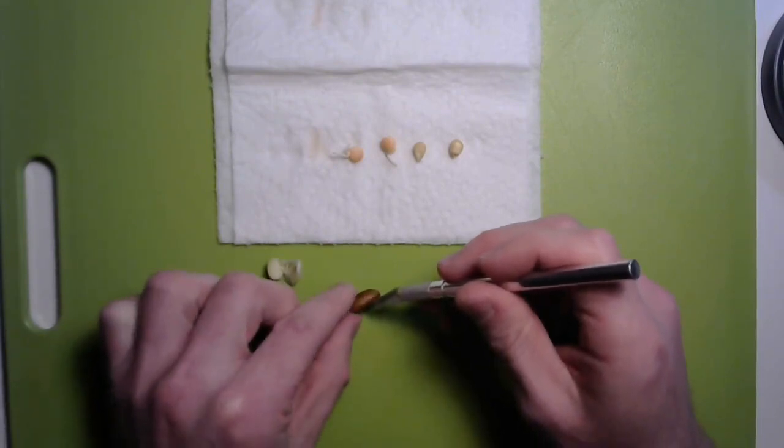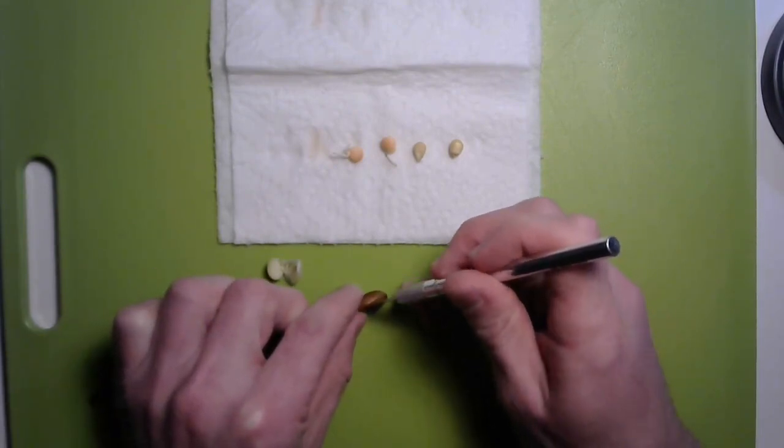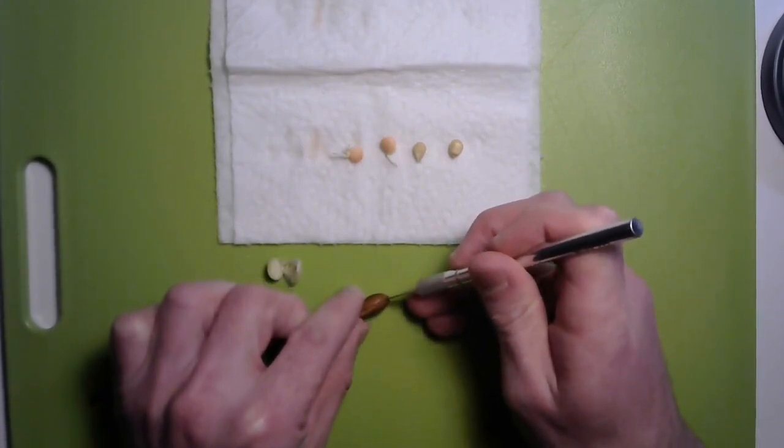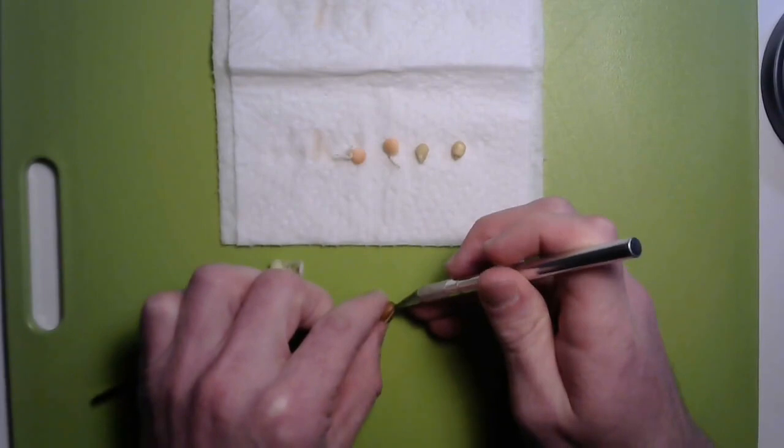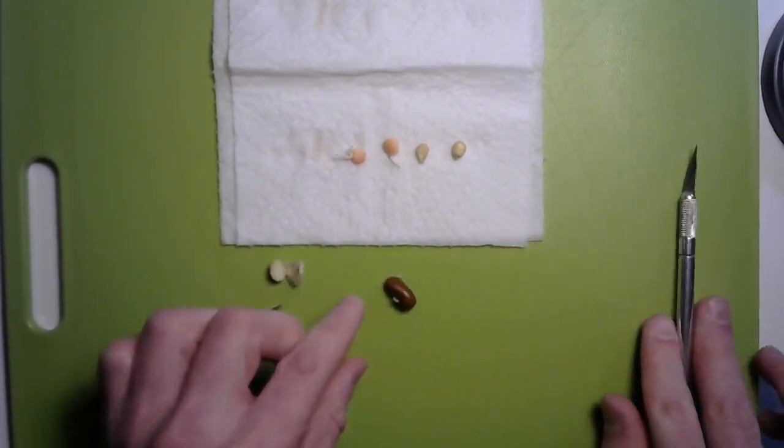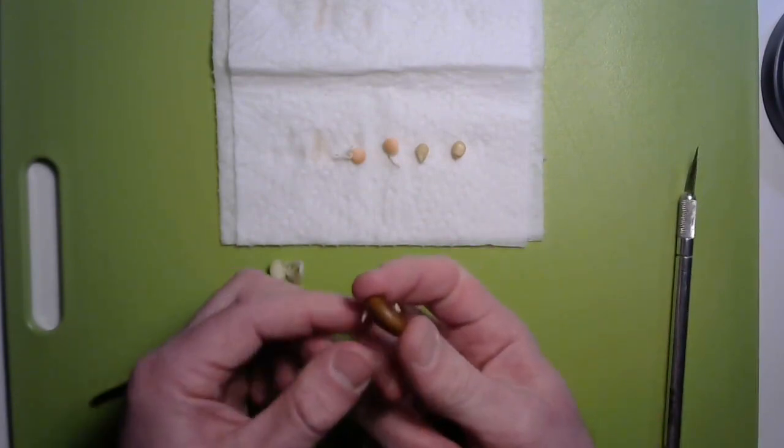Okay, this one's being a little bit harder. Be careful if you need to use your fingers. You want to try to use those tweezers if you can, but if you've got a very slippery bean like I do, that might be a little bit easier. All right, let's see if we can get that one open.